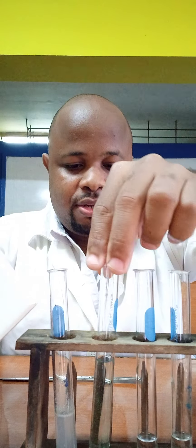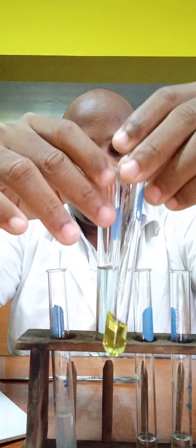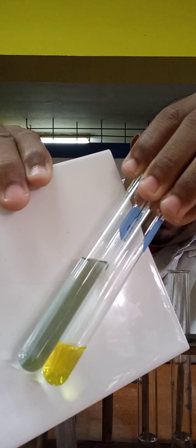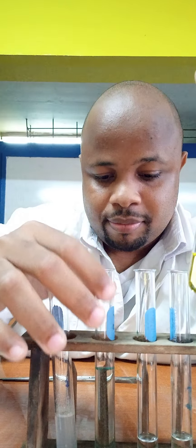Remember, for liquid B it appeared yellow — or rather orange. Let's put them side by side. You can see that liquid A changed from orange to green, but for liquid B it stays the same.